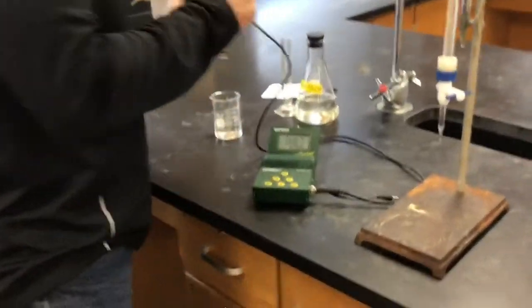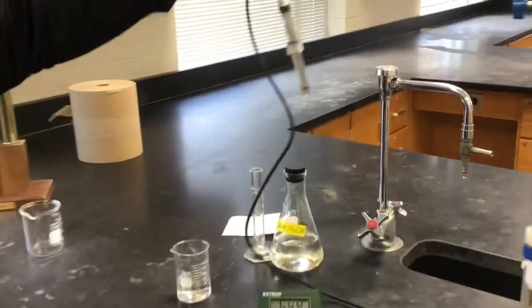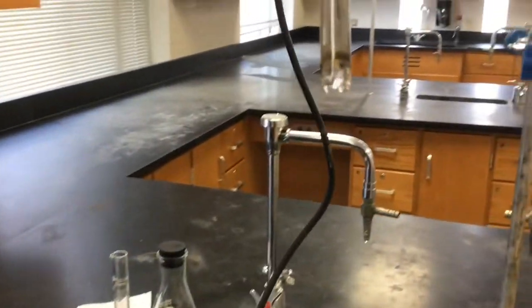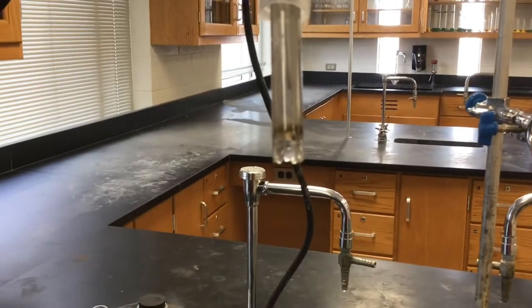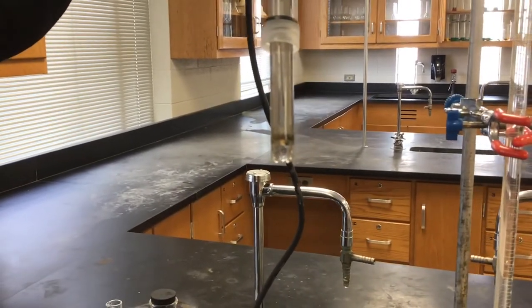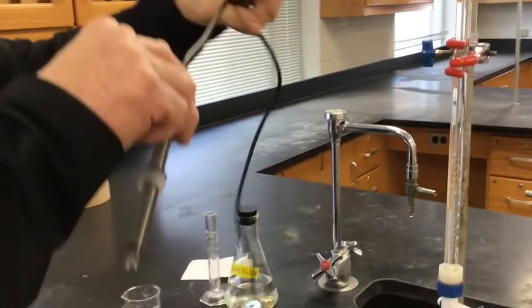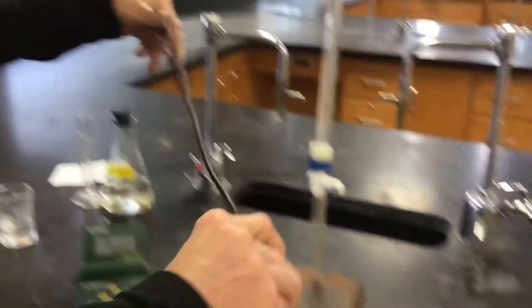A pH meter has a little glass electrode — it's probably kind of hard to see — but that's what's actually helping us record the pH.